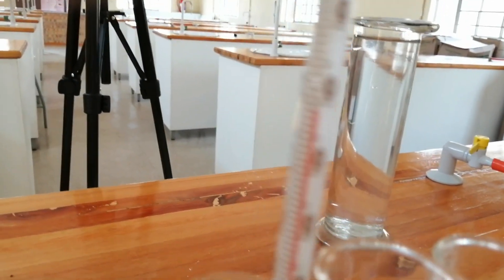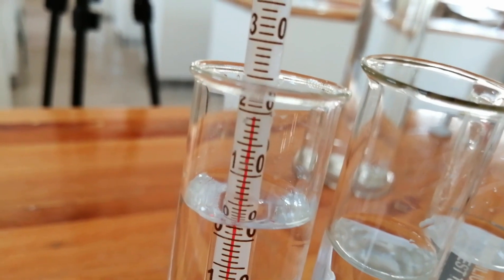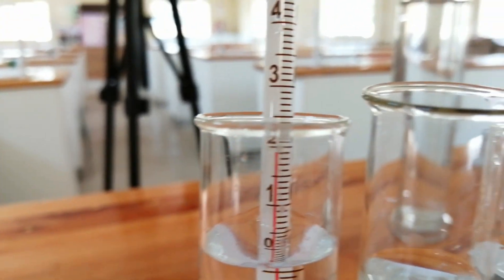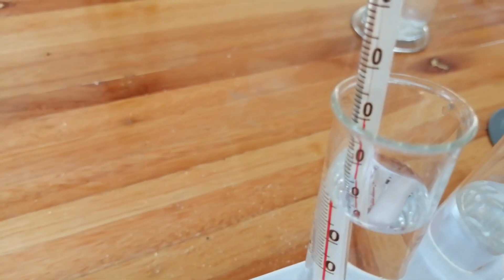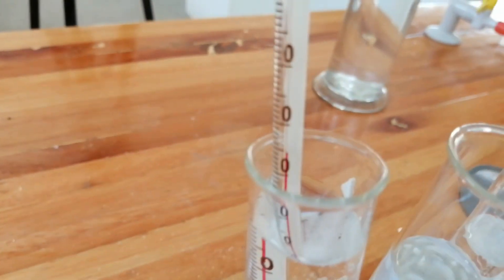Now I am going to add some calcium chloride granules. This is calcium chloride — I'm taking one spoon of calcium chloride and adding it into the solution. We must check whether the temperature is increasing or not. Keep your eye on the temperature — it was 20 degrees before. Let's see what happens.